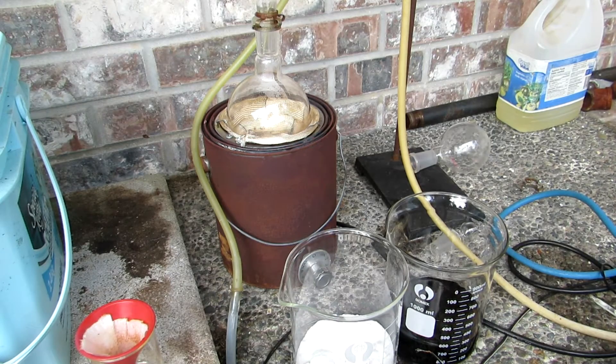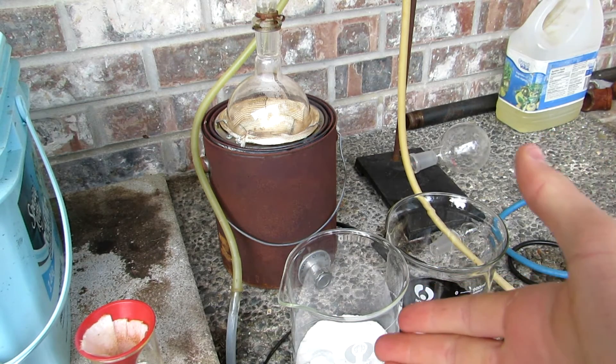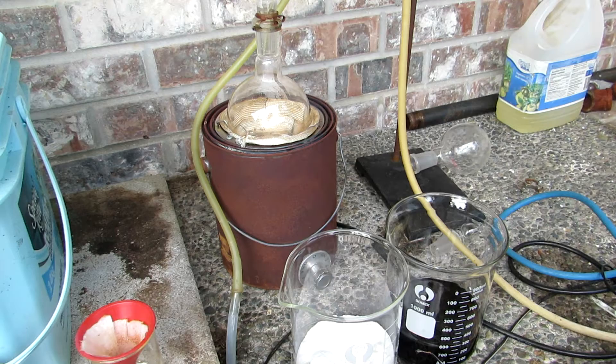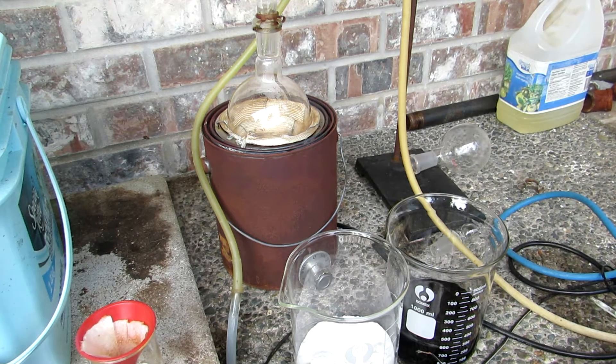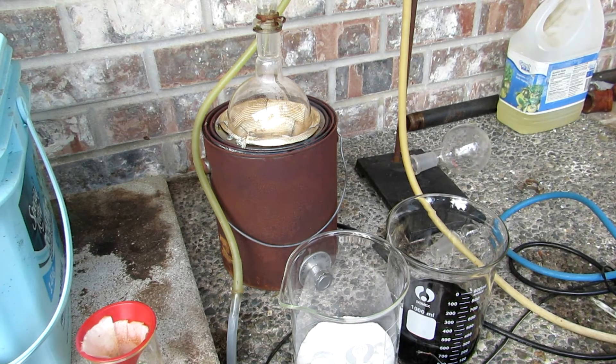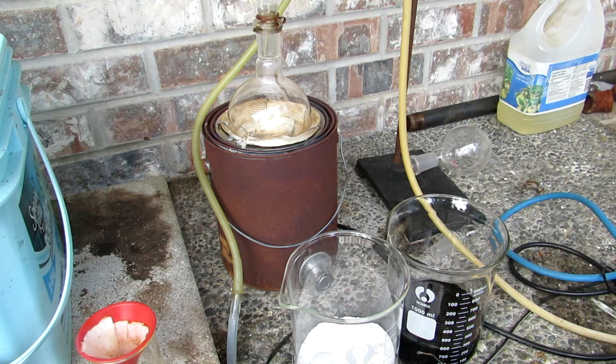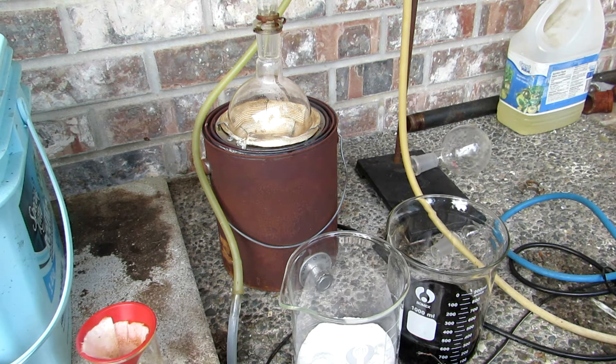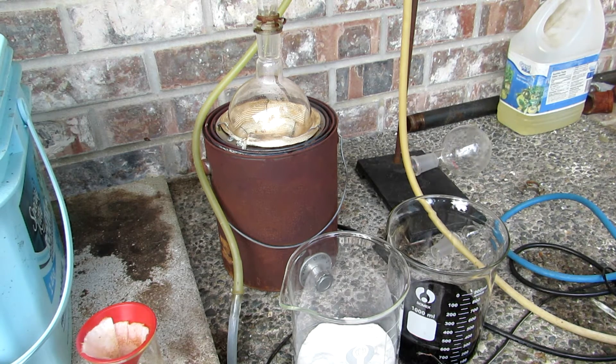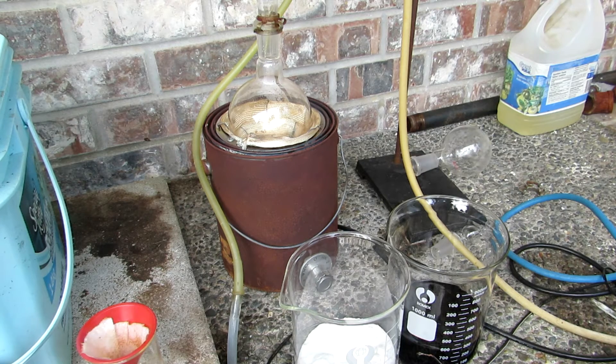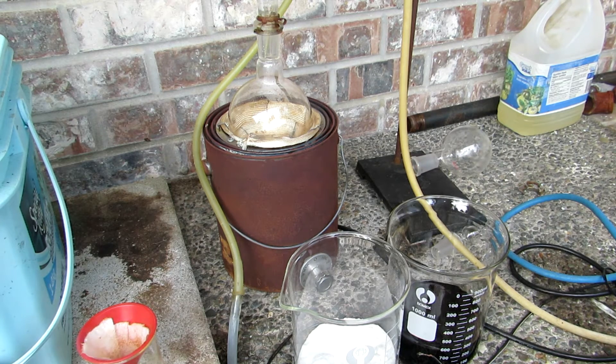Now, for this particular concentration of sulfuric acid, we're going to need about 400 grams of potassium nitrate and 300 milliliters of 70% sulfuric acid. Now, I did have a slight excess here, and that's just to account for the fact that I have a bit of uncertainty with the exact concentration of our sulfuric acid, and this will just ensure that all of our nitrate salt is used up.